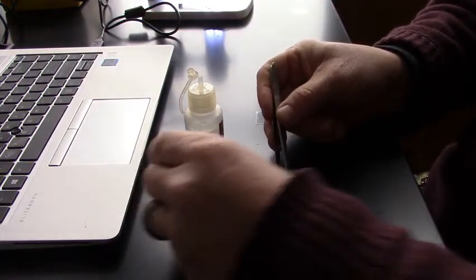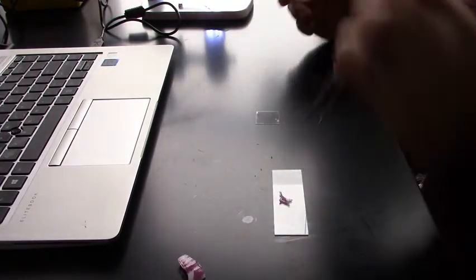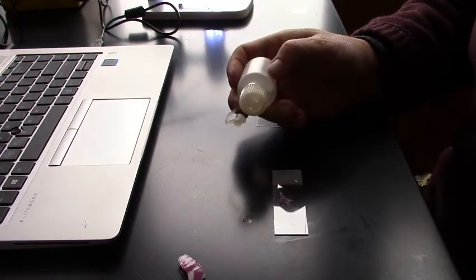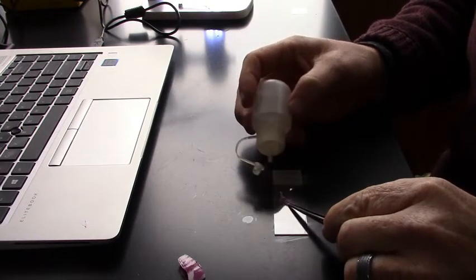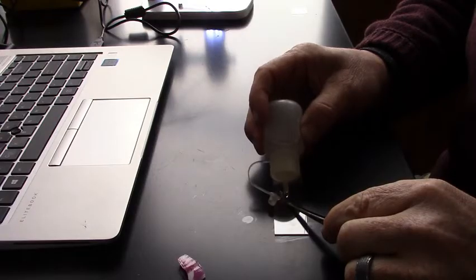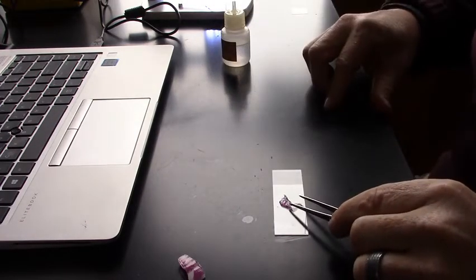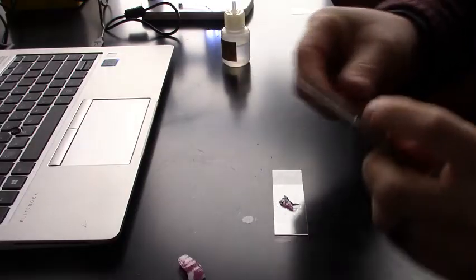It's pretty fragile. And what I'm doing here is adding a very thin piece of that onion skin to a slide with a little bit of tap water. That tap water is pretty much the same concentration as the water making up the cytoplasm in those plant cells.